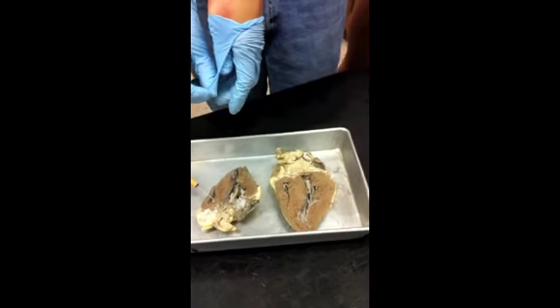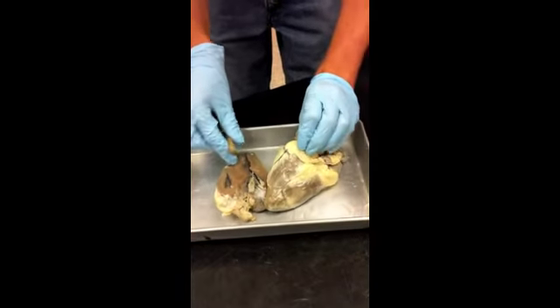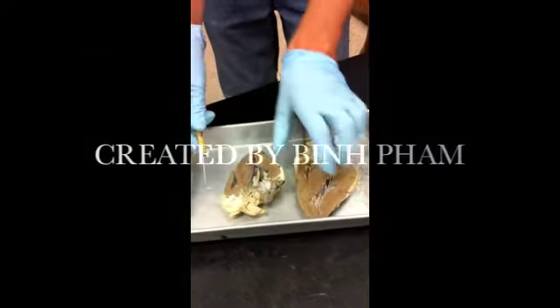Would we identify anything from the outside of it? Interventricular sulcus? Oh no. From the outside, no. Don't worry about that. We'll just do that on the model. But just know this interventricular septum. Okay. As far as the outside stuff, let's just leave that to the model.